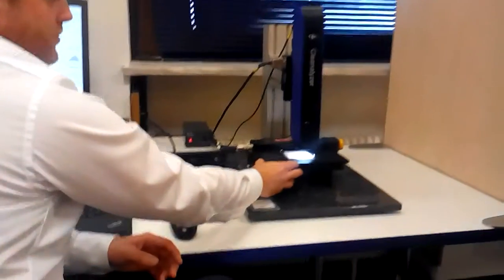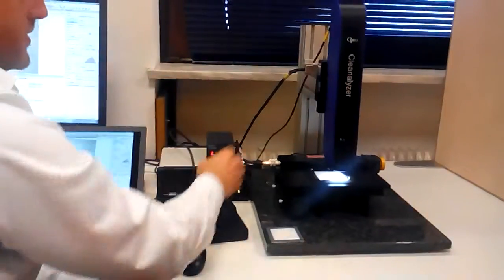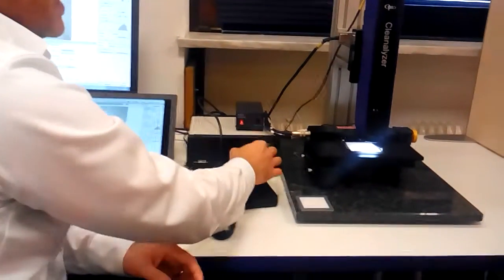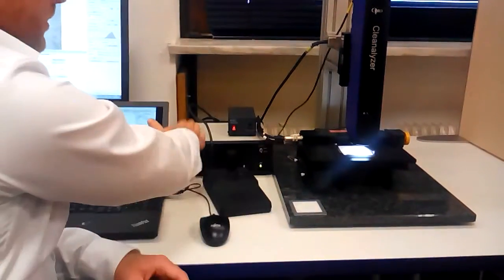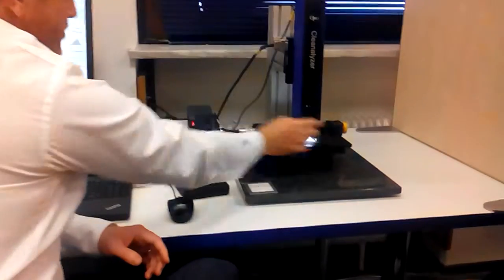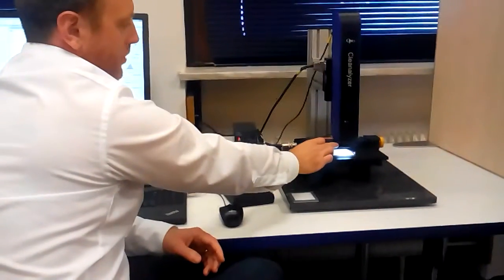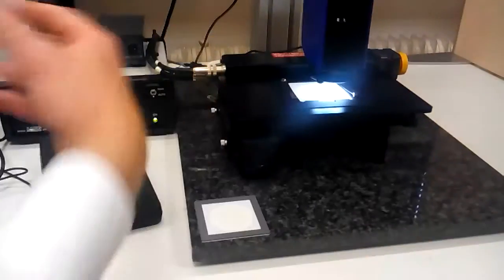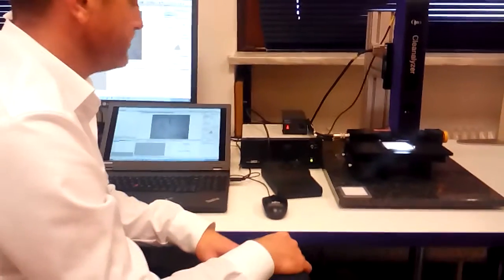We then have a motorized XY stage, and also with this 5 micron system, the motorized Z height. So we have a joystick control in X and Y, and then also a focus system integrated here through our LAN controller. Illumination is provided by a specialist ring light, which has an independent control on brightness. And then we also have a polarizer feature, and this is a critical function in determining the difference between a metallic and a non-metallic particle, as we'll show you in the software.